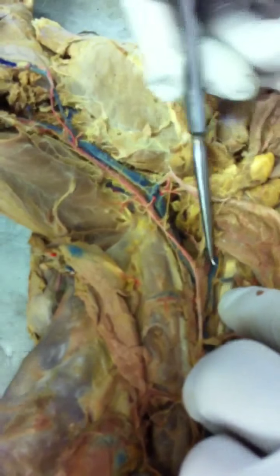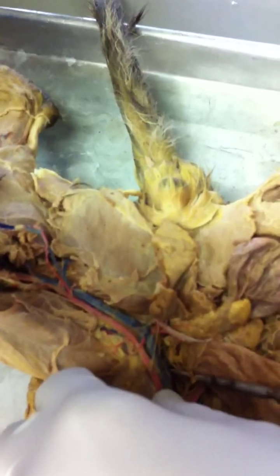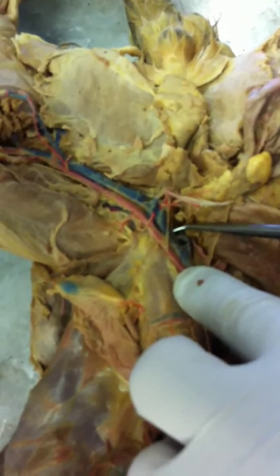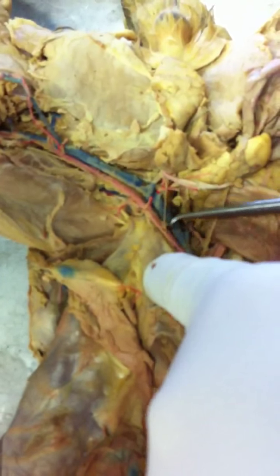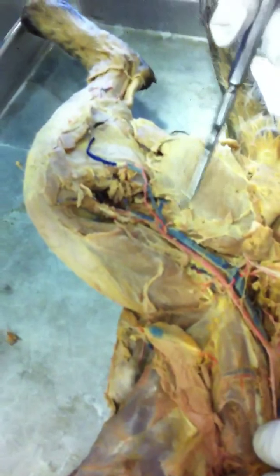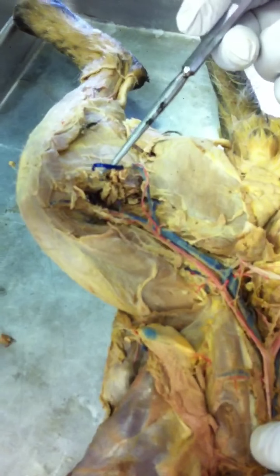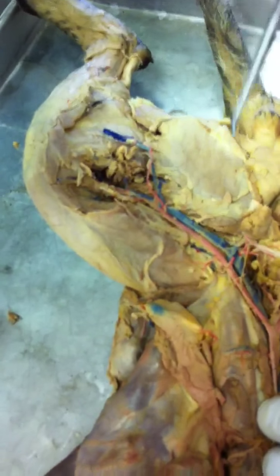Now, the common iliac vein receives two tributaries. The internal one is the internal iliac vein. It's right there. It's the first branch. And the remainder, this right here, is the external iliac. The external iliac, following the external iliac artery, goes out into the leg and becomes the femoral vein. The femoral vein then divides into the great saphenous, not saphenous, but great saphenous vein, and the popliteal vein. Good? Okay, let's go to this other cat.